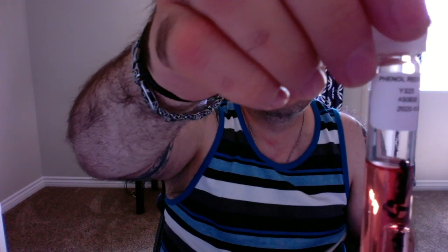Alright, so now we're going to look at the S. epidermidis with glucose, which is here. There we go, S. epidermidis glucose. And as you can see, this pretty much looks very similar to the identical phenol red that I poured in initially. And there's my Durham tube, which is pretty much flat. It's still untouched. There is a bit of gas there, but this tube has sat for in excess of 13 hours.